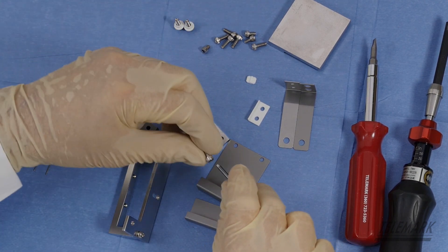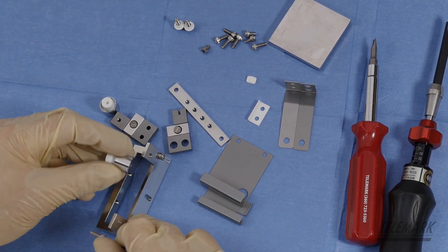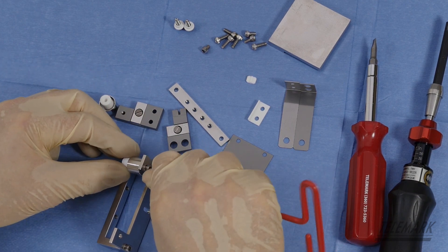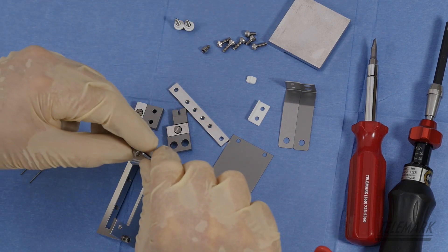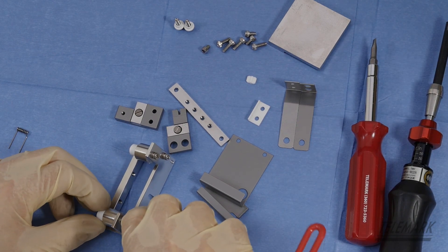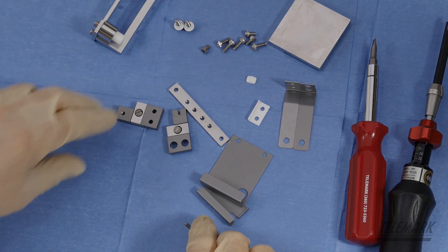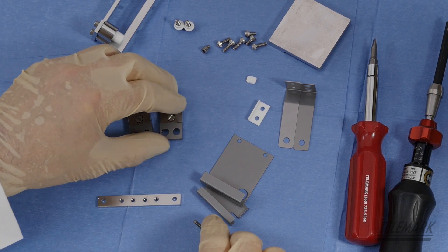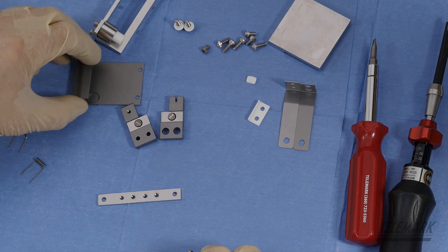And your 632 by 3/8 inch. You've got insulators and another one of your 632 by 3/8 inch. You've got high voltage shield and high voltage insulators. Just kind of rough fit them. Just snug them down. Then you mount your mount bracket. Move this stuff off to the side. You don't need it just yet.